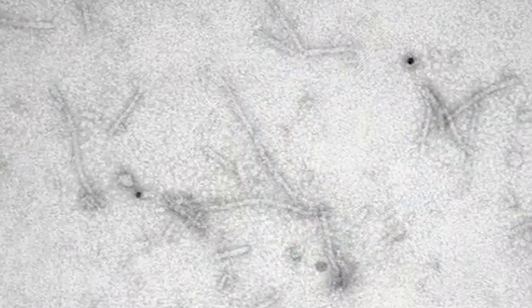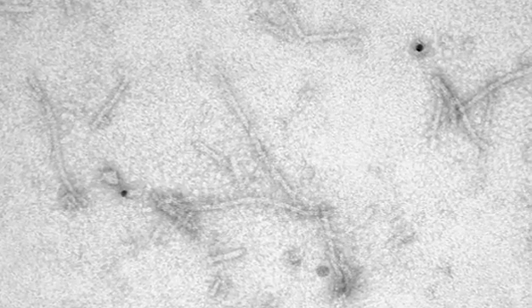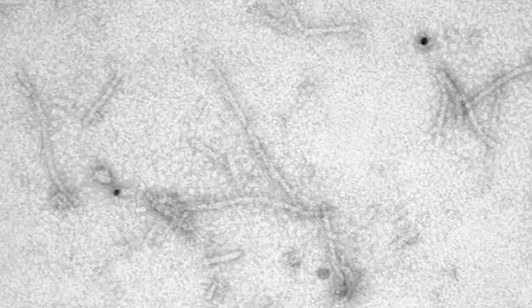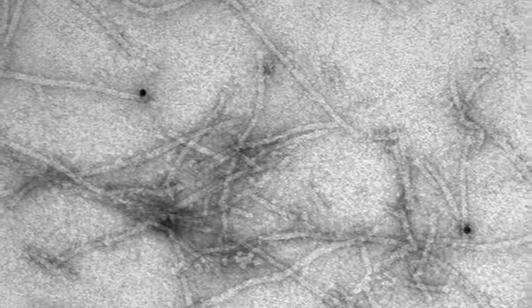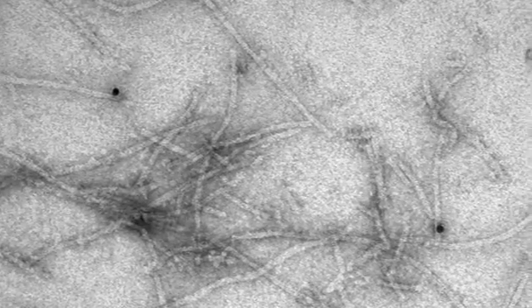We are using the gold labelling. We're trying to use the gold to target one of the proteins to locate the protein along that filament. We work on a protein complex made up of three proteins. Initially we had some problems producing nice, clean images, but then we changed our protocol a little bit and it looks great now.